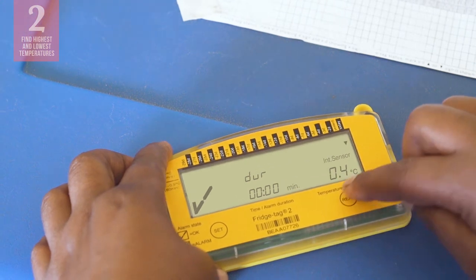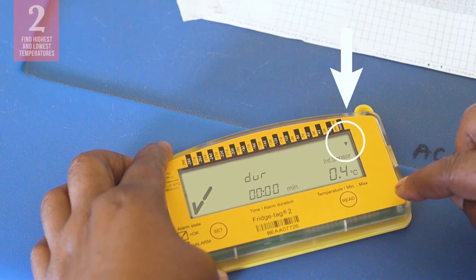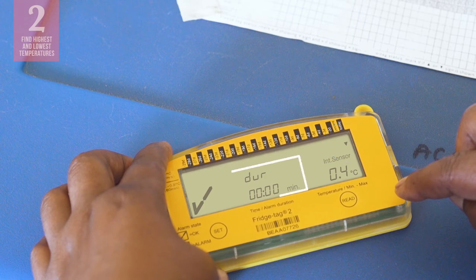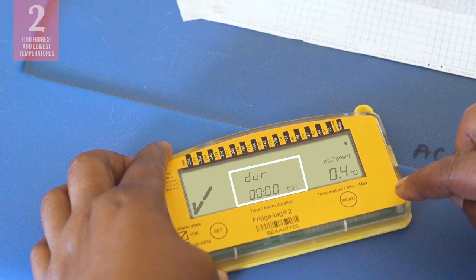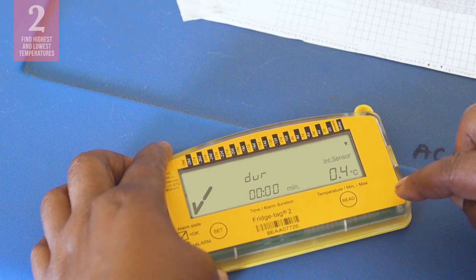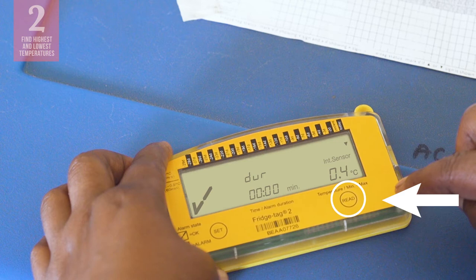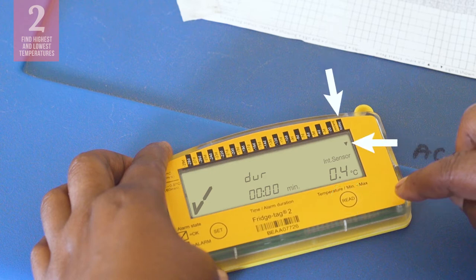Press the Read button again. On the top of the display, you will see the amount of time that refrigerated temperatures were below negative 0.5 degrees Celsius today. You can keep pressing the Read button to see high and low temperatures, going back day by day for the previous 29 days. The flashing arrow at the top of the display will show you which day's temperatures you are looking at.